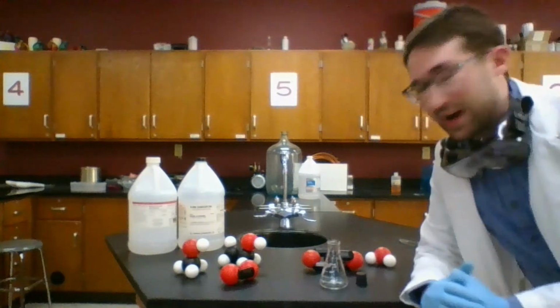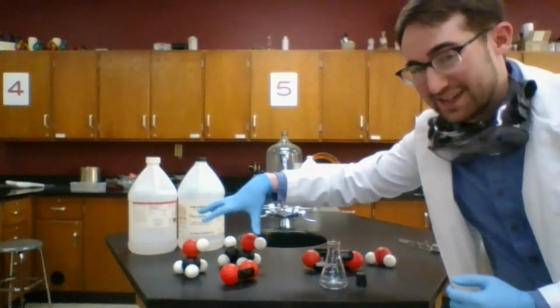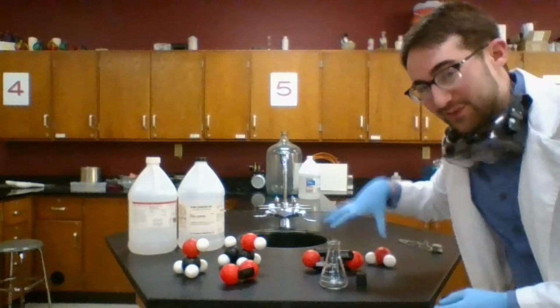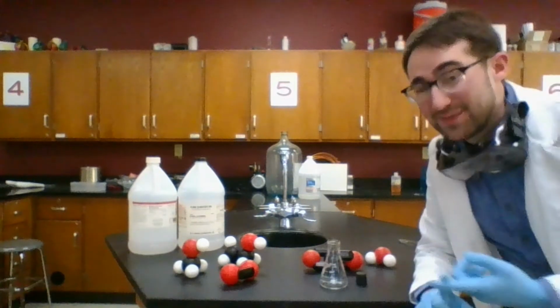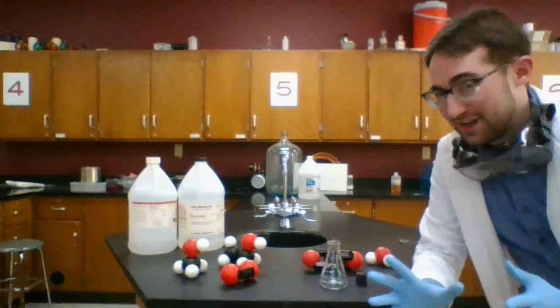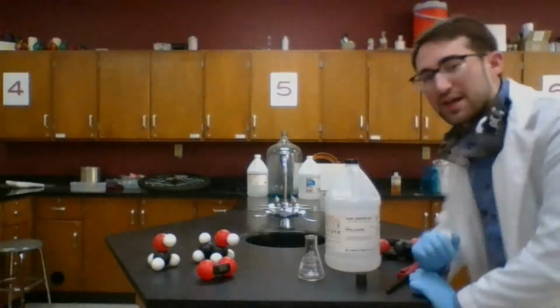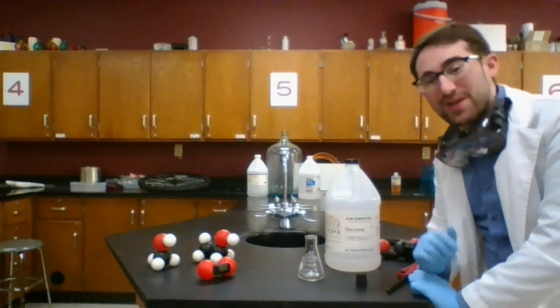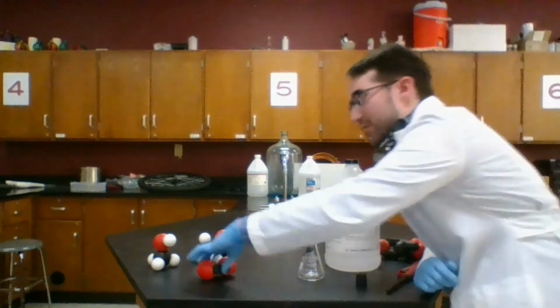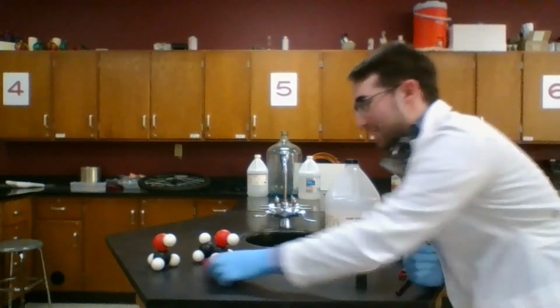Okay? The number of molecules, number of particles of our reactants that it takes to make a certain number of particles of these guys without losing any atoms and without gaining any atoms, keeping everything conserved, mass and energy, depends on how we balance the reaction equation. In this reaction, both ethanol and methanol are going to combust by reacting with O2 gas. And we're going to show what that looks like in the lab.